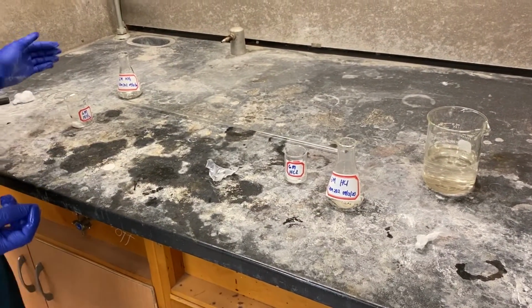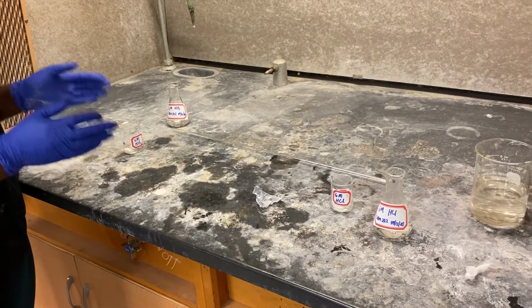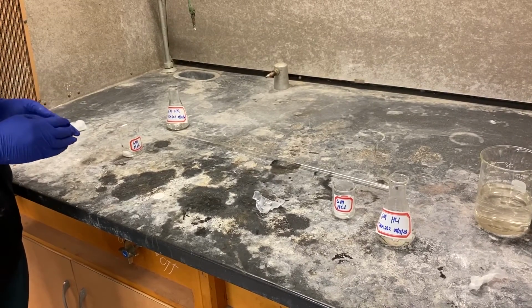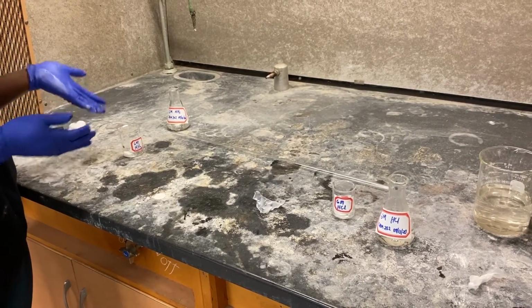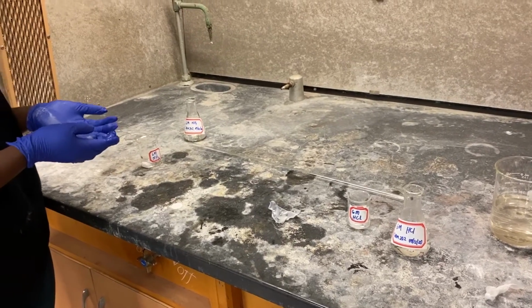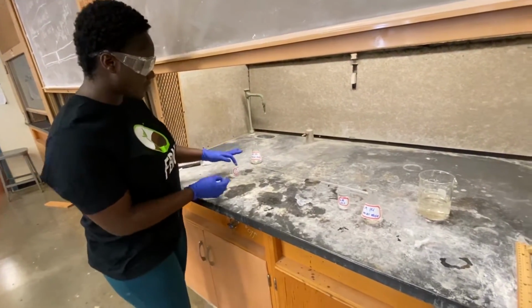And one thing though that we have to take note of is both of these wools have to get into the glass tube at the same time, and so we have to watch them carefully because if they don't get in at the same time, then there's no good judgment, if I may put it that way.